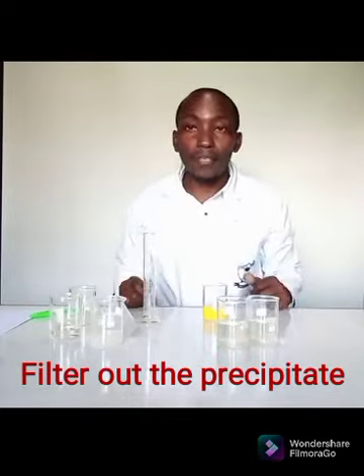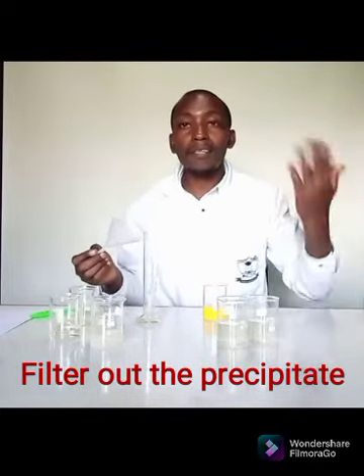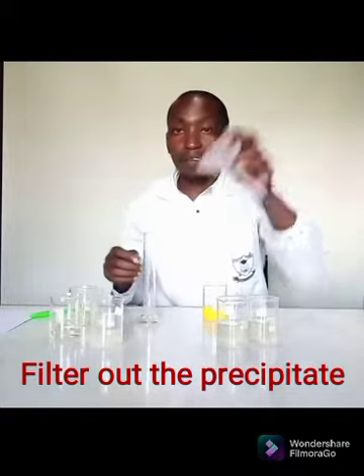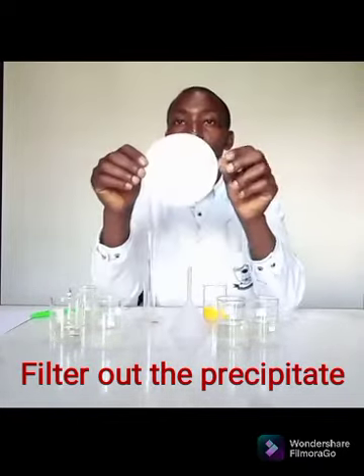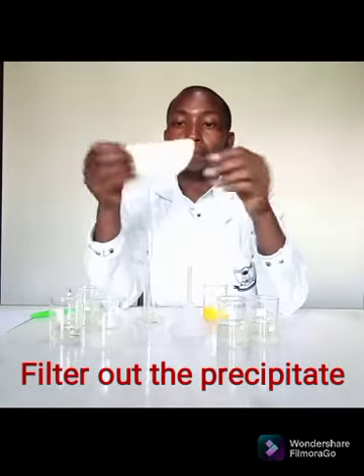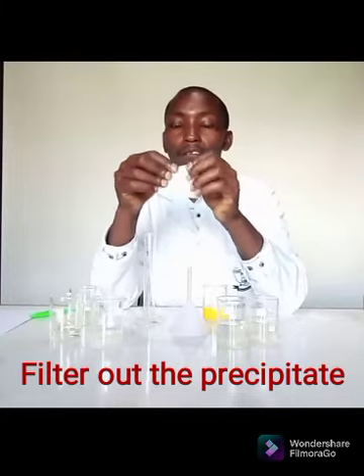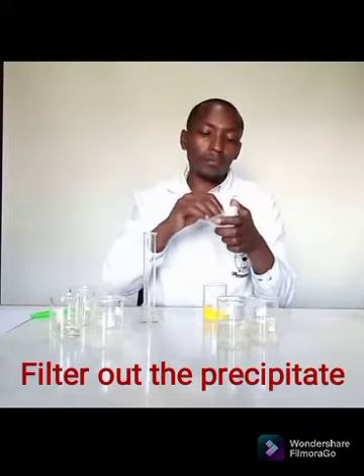So what do I do next? I need to do filtration because I have an insoluble solid in a mixture. I need a filter funnel. I'm going to have a filter paper. So I'll fold the filter paper for it to fit into the filter funnel. Then I will lower it in.